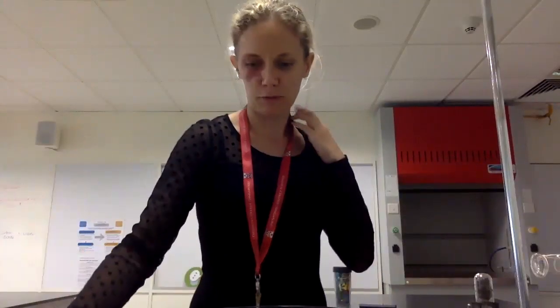Afternoon Year 10, as promised, we're going to run through these few demos of how we calculate the percentage of oxygen that is present in air. They are in increasing level of accuracy and precision.